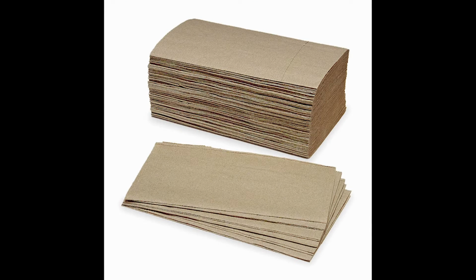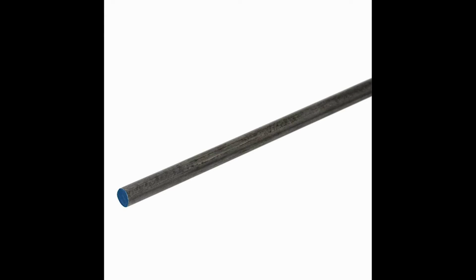In this next image, we identify some fibers and wooden elements. Can you guess what this is? It's a paper towel. Now let's look at our final microscopy image, and can you guess what this is? After looking at the image, does its dark color and appearance or sharp edges help us identify what it is? It's a metal rod.